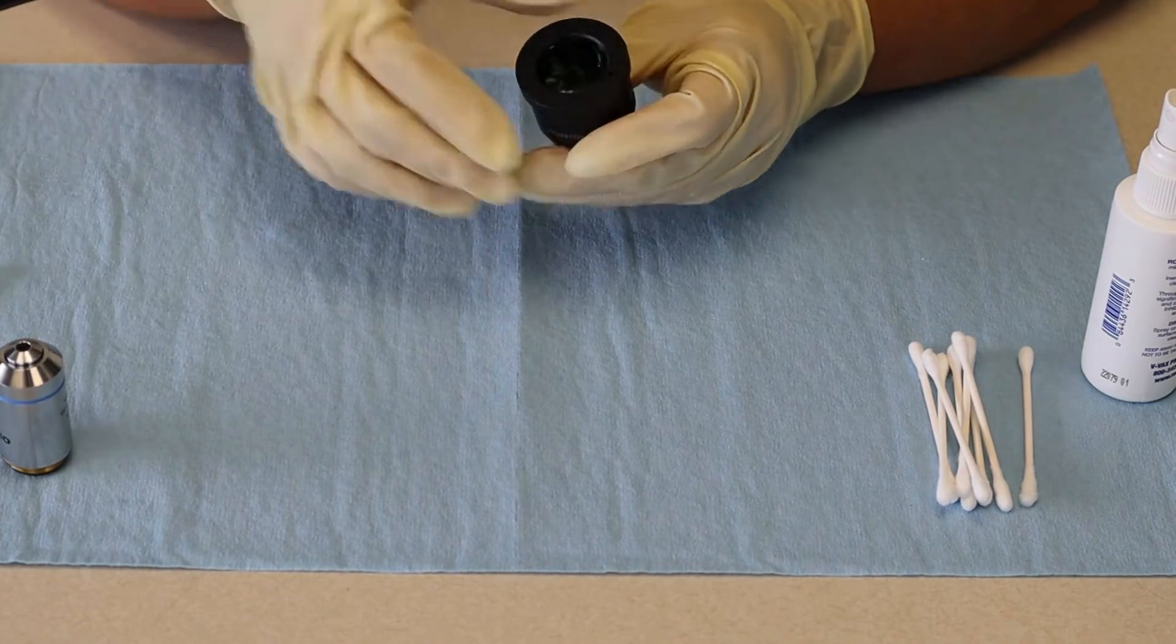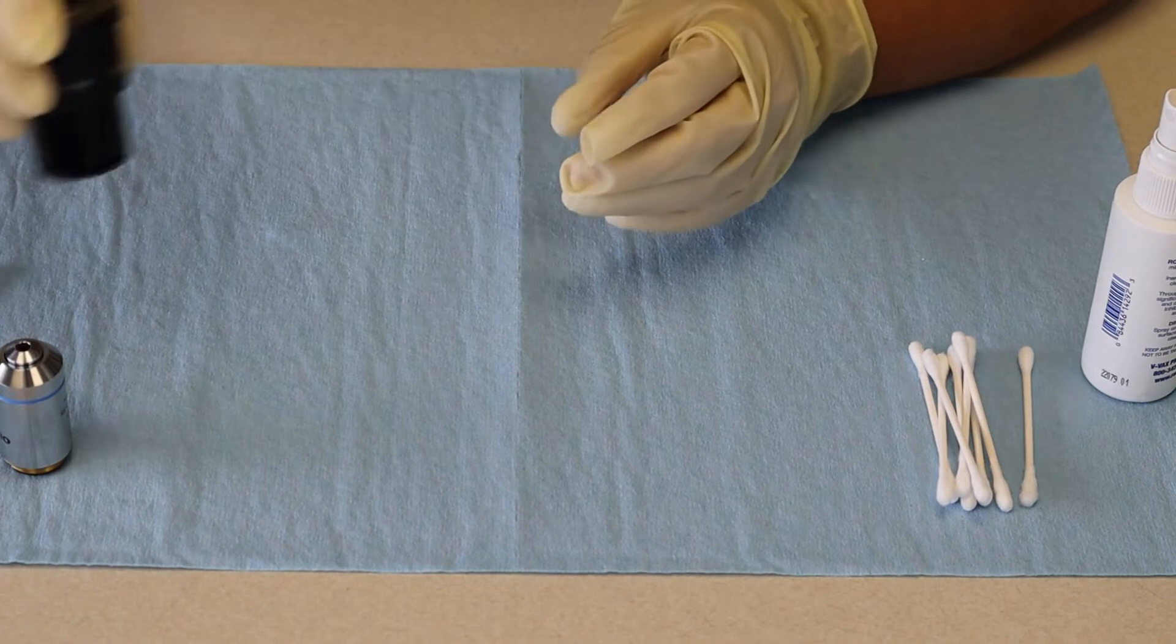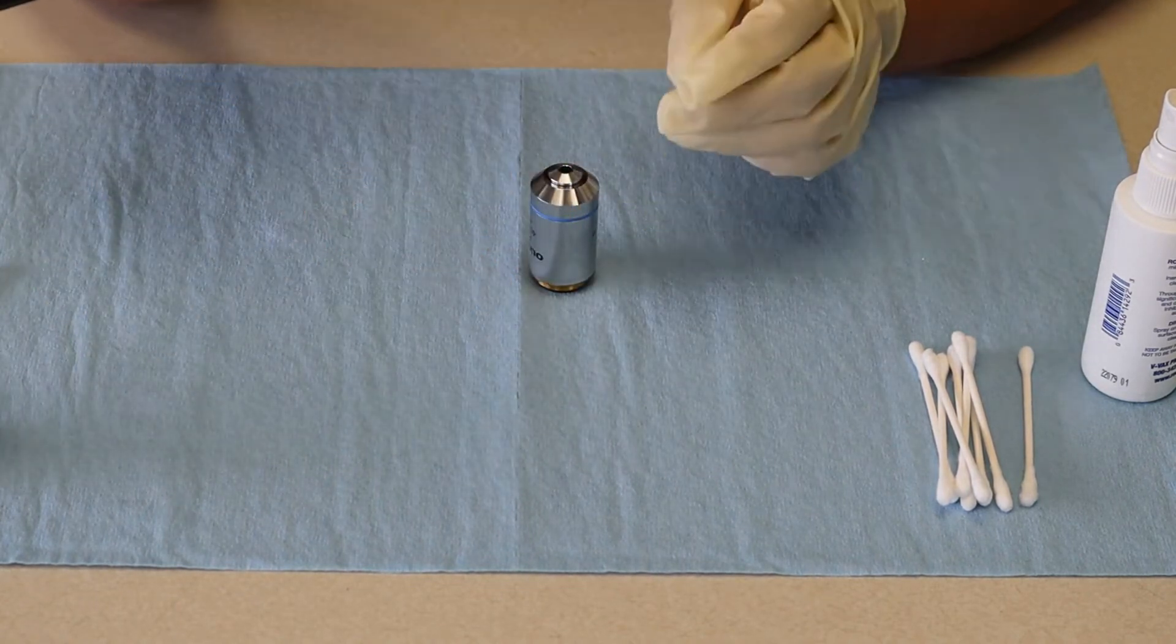Okay, just make sure you got everything off. Looks pretty clean to me. We'll put that to the side and start with our objective.